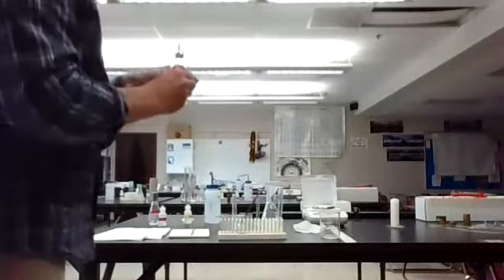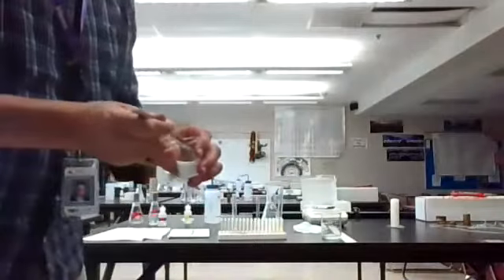Okay, I'm going to measure out some vinegar. That's what I have in here. We're supposed to go 20 milliliters. I'm just going to pour a small amount of vinegar into my beaker, roughly 20 milliliters. More. There we go. Then I need to put just a pinch, a small amount of salt. So I've got salt here. I'm just going to take my scoopula and get that salt, drop it right in there. Before I do anything else, I like to swirl this to try and get the salt all dissolved.